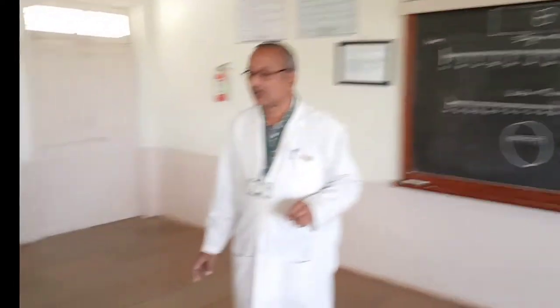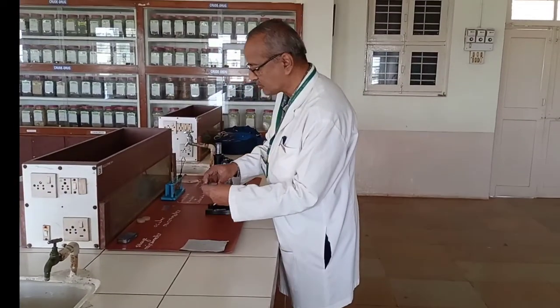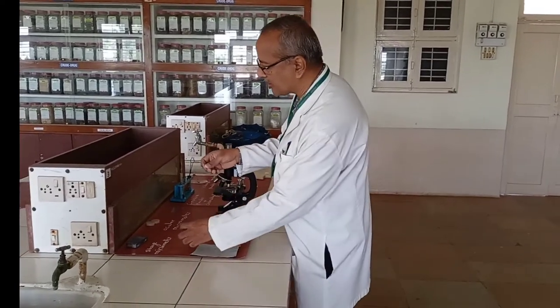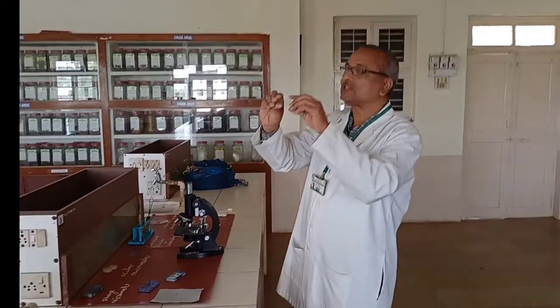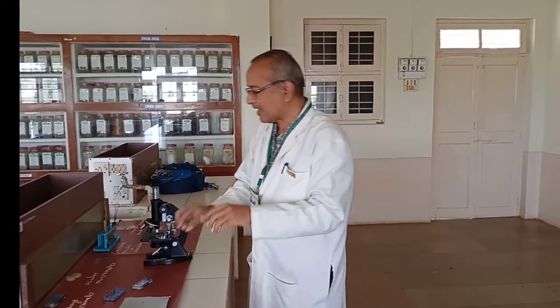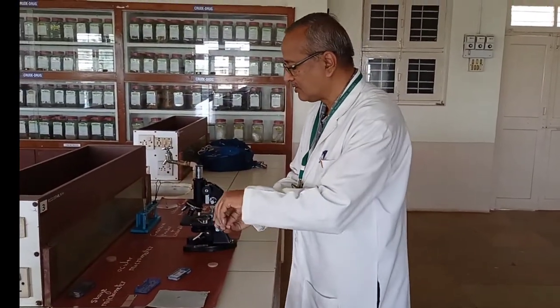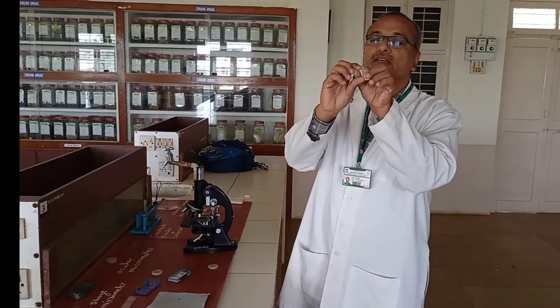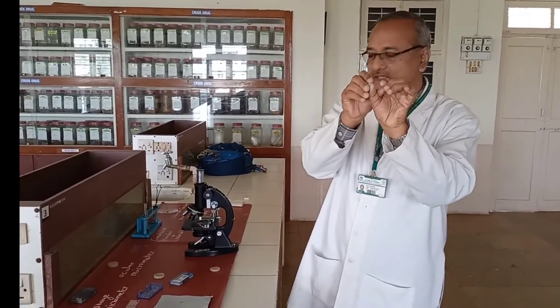Let us look at what the stage micrometer and ocular micrometer are. The stage micrometer is a slide with 0 to 100 divisions, measuring 1 mm. The ocular micrometer is a disc inserted in the eyepiece, also graduated 0 to 100 divisions, but it does not have any actual units — only the division lines can be seen.